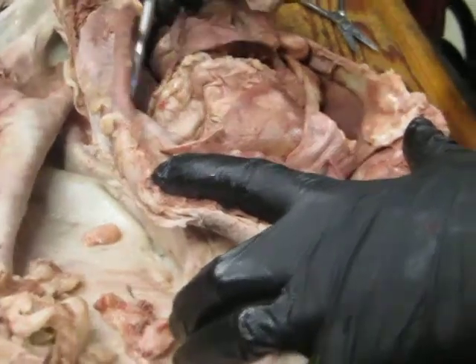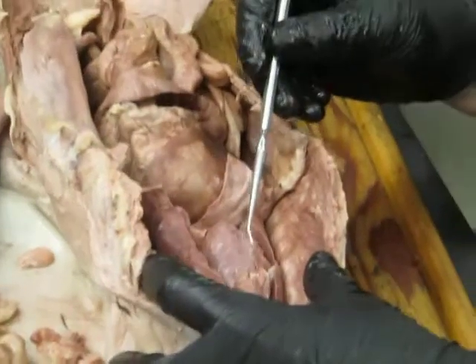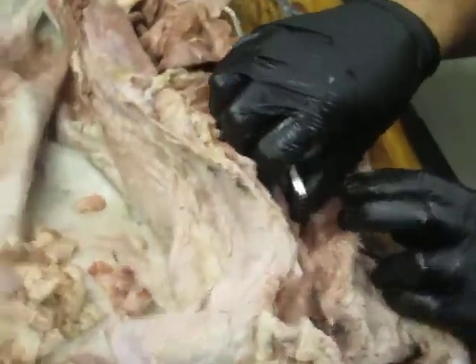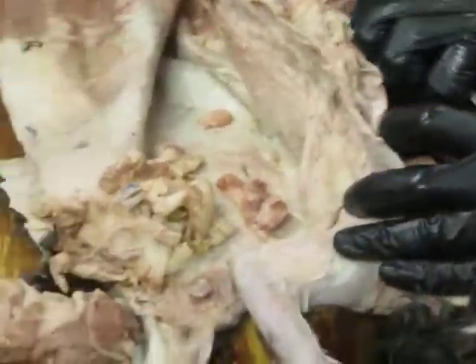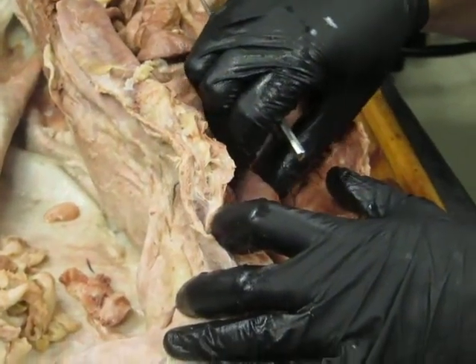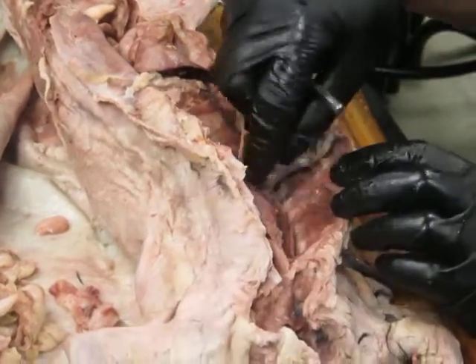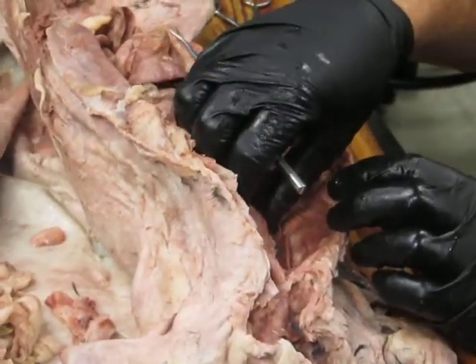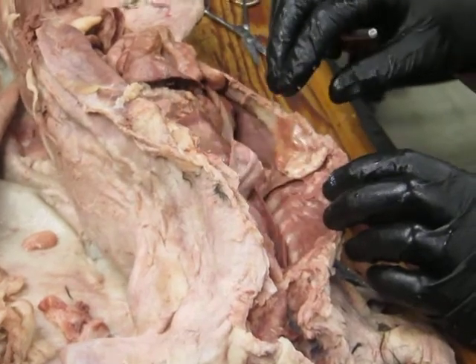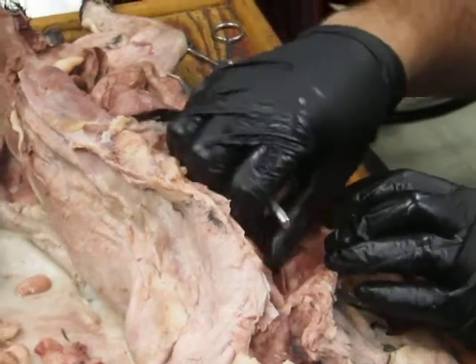Peritoneal cavity, pleural cavity, there's the lungs, heart. What's this partition that the heart sits in? Did you guys run into that term? Pericardium? It's in the pericardium, but this whole middle septum between the lungs is called the mediastinum. Did that term come up? Yeah, we looked at it. Okay. But anyway, I just thought I'd mention that.